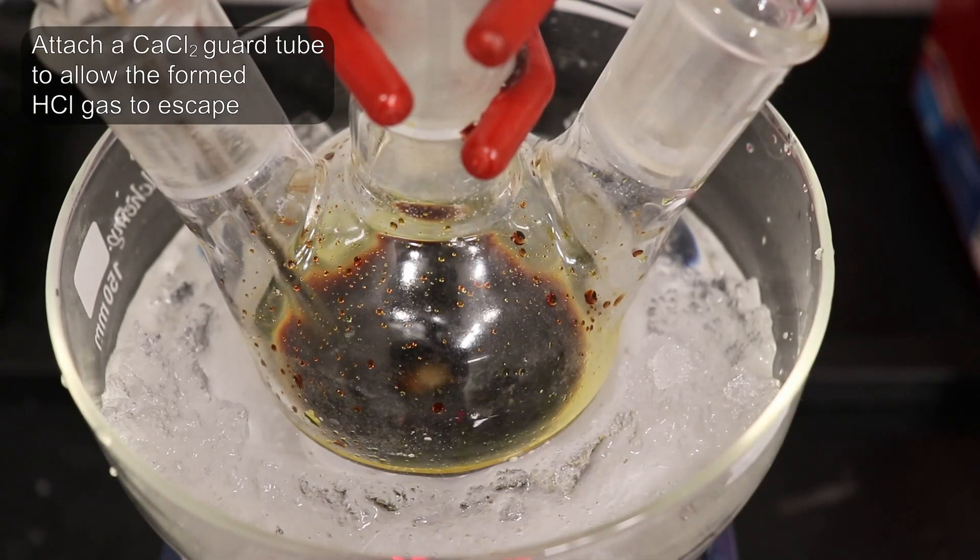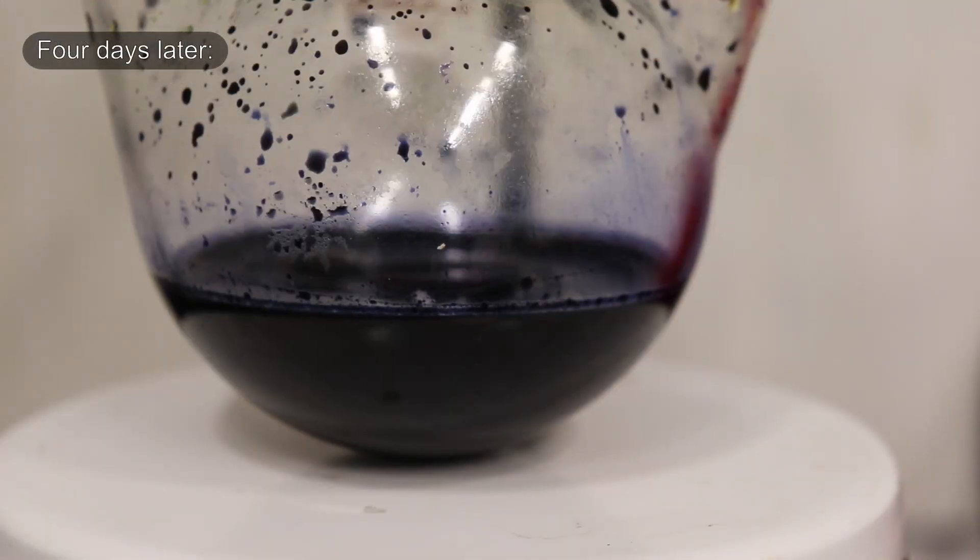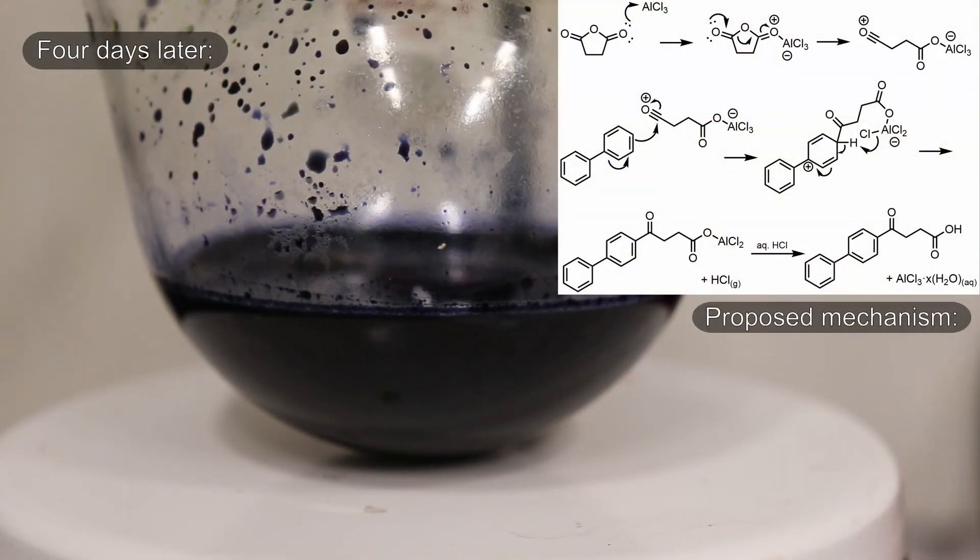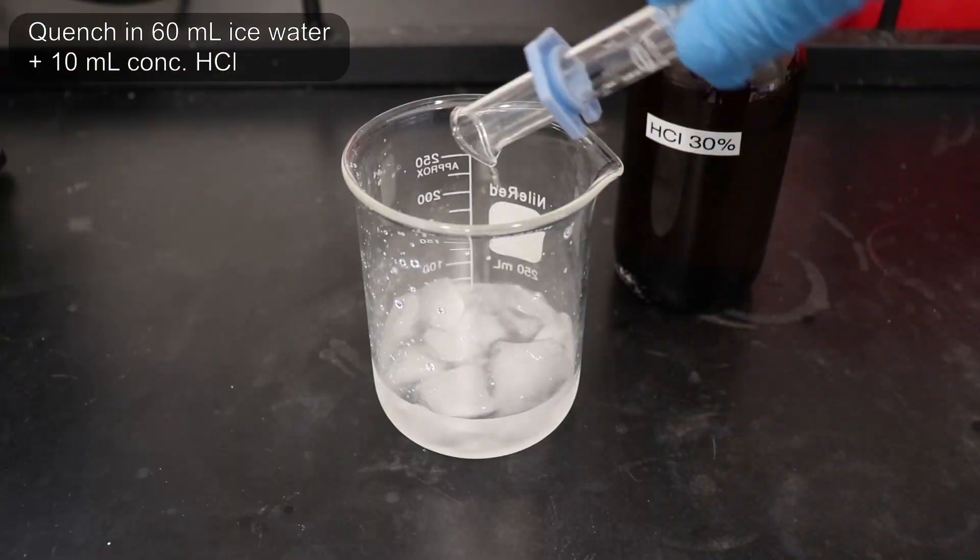Once the addition had been completed, the reaction mixture was allowed to stir at room temperature for 4 days. And yes, that's actually in the procedure. I didn't just forget about the flask for half a week. I suppose it's just one of those really slow reactions.